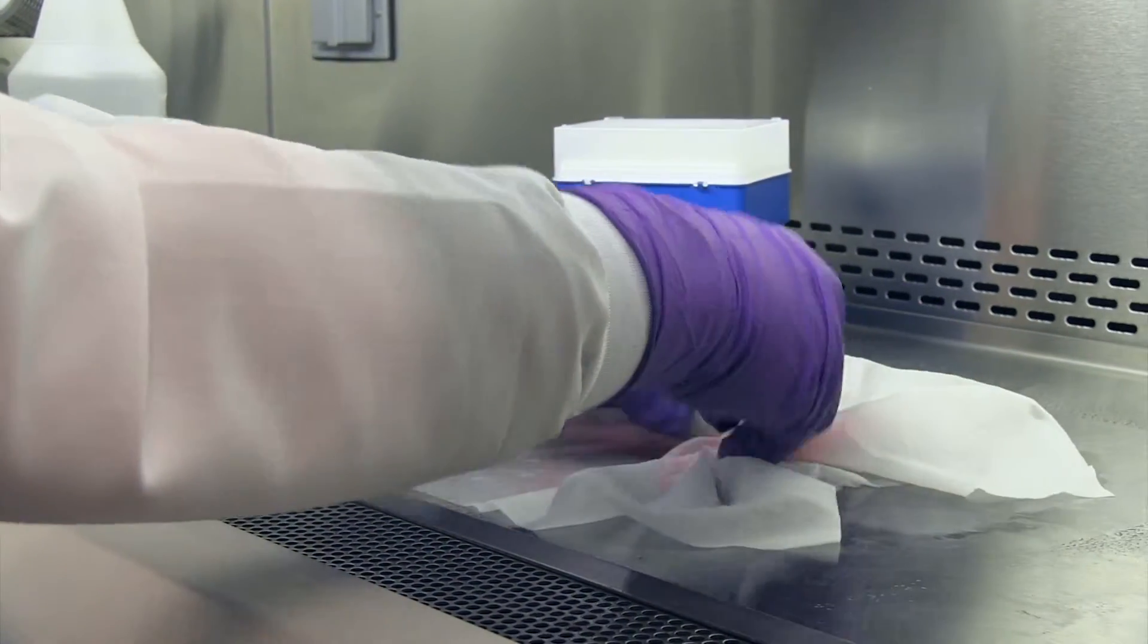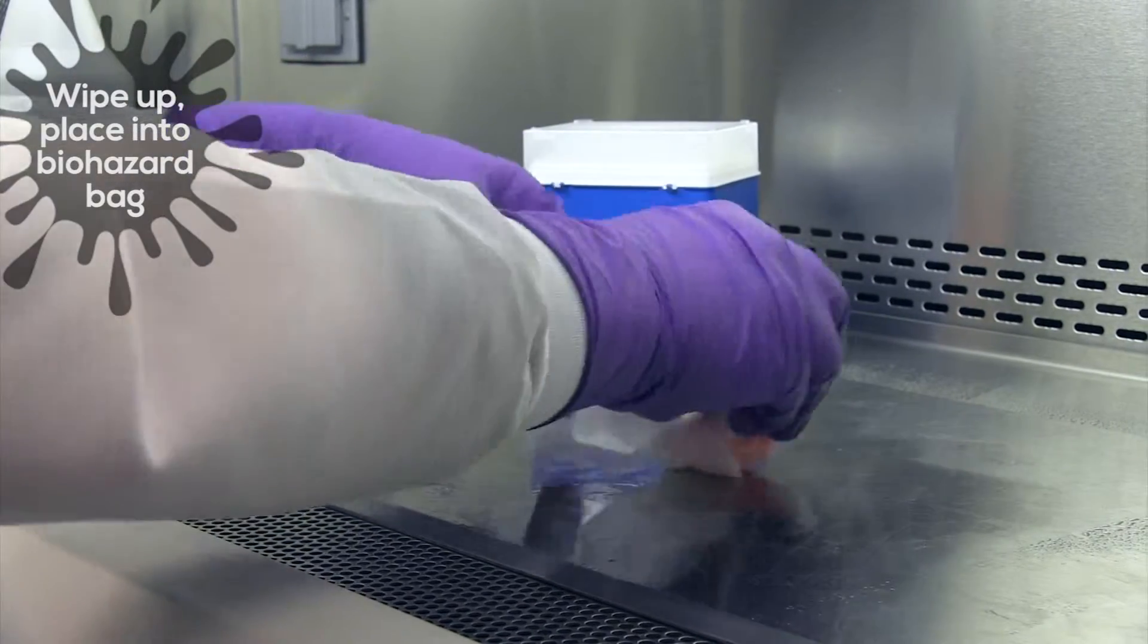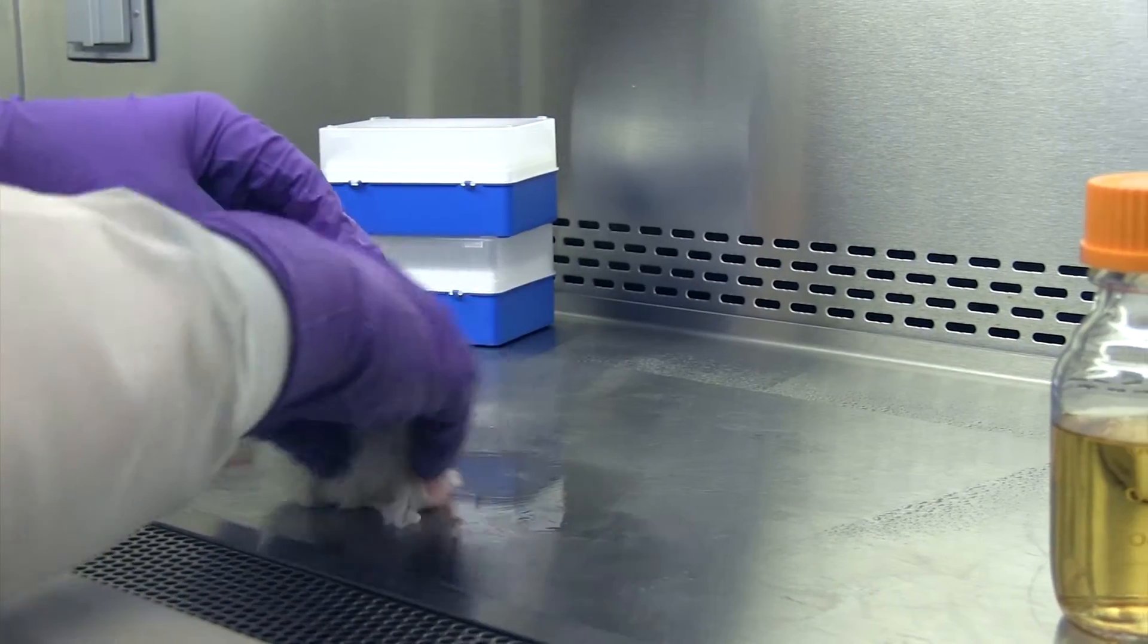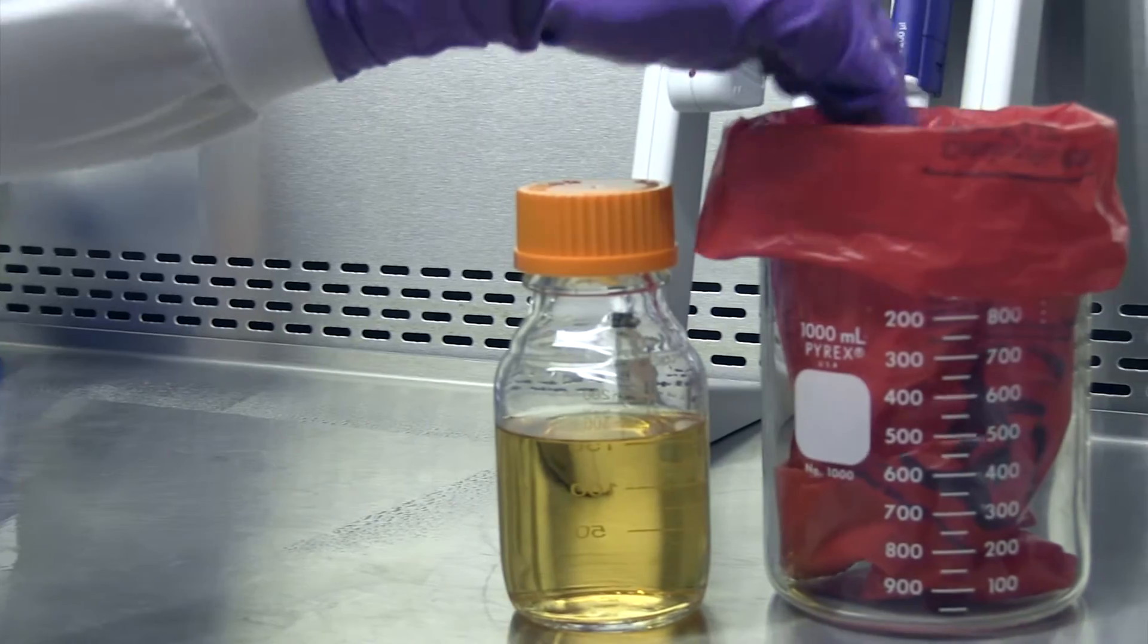After 15 minutes has passed, wipe up the spill and place the absorbent into the biohazard bag. Remember that the waste receptacle must be located inside the biosafety cabinet.